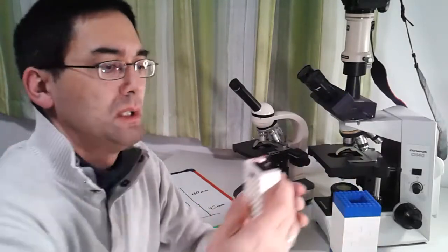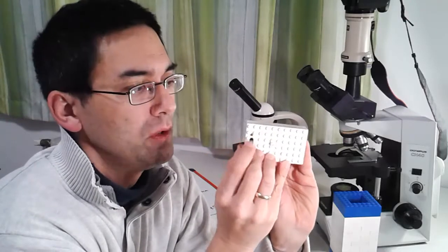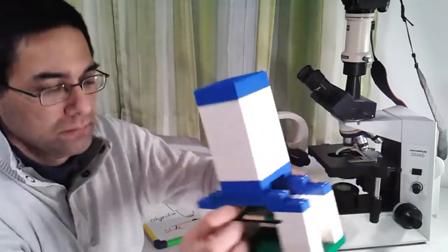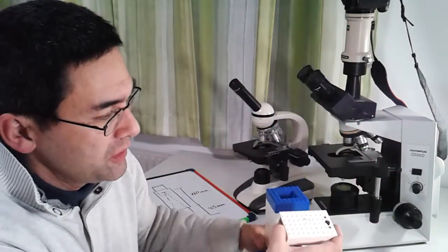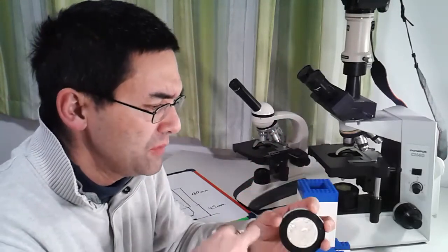I've also done the following: I put an LED over here and a little switch over here, so you can also turn it on and off. This can also be mounted on the bottom. I've got a battery over here. I actually only wrapped the wires — I didn't even solder much. But you do need a resistor as well, otherwise you're going to break the LED. This one is not quite as bright because it's only three volts, while the other one has three batteries, so that's a little bit more.